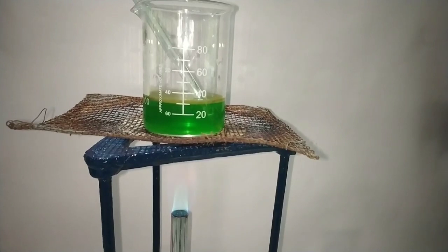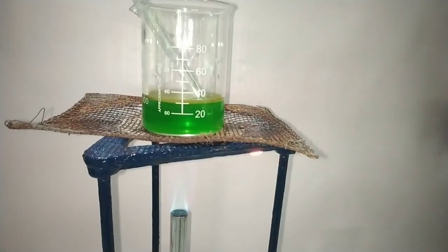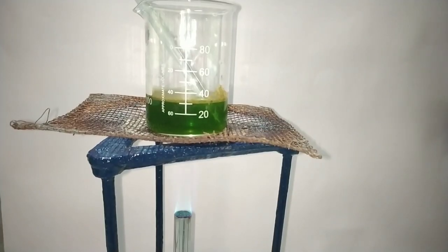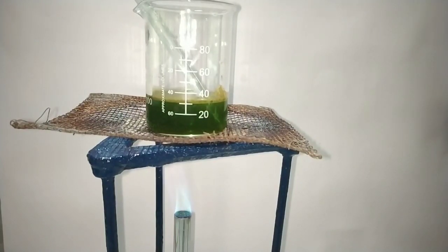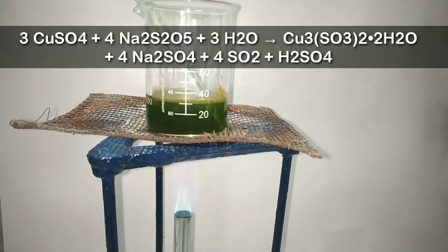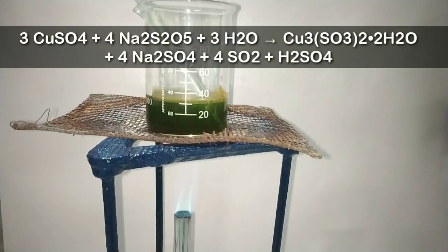The next step is to heat this solution to boil to get our desired product. After about 10 minutes you can start observing a color change in the solution. The emerald green color has started turning dark. Stir occasionally to spread the heat evenly and to avoid bumping.